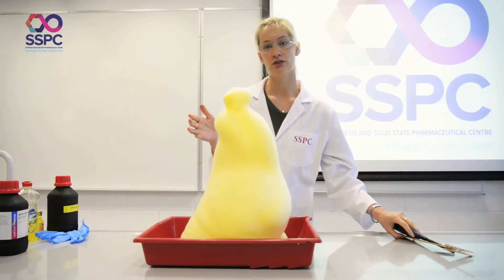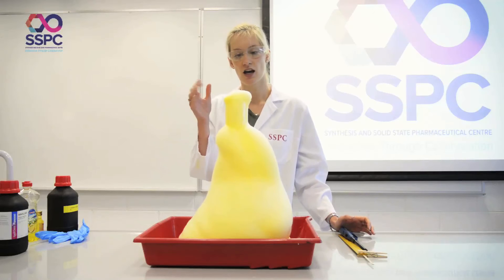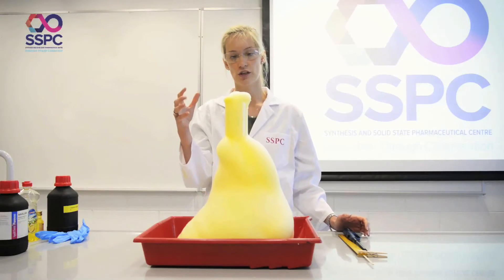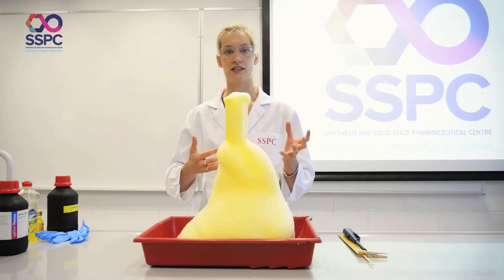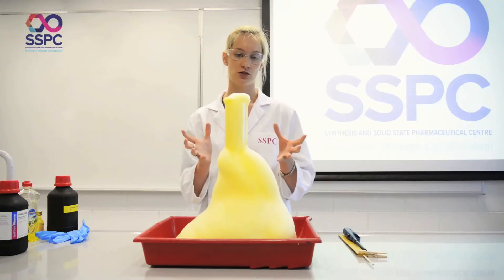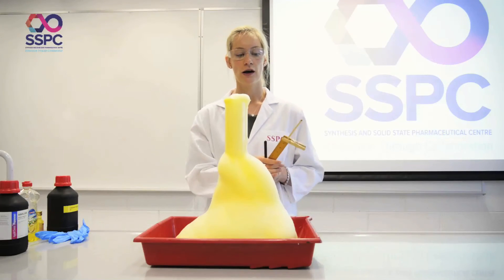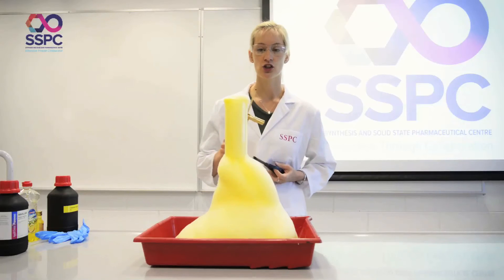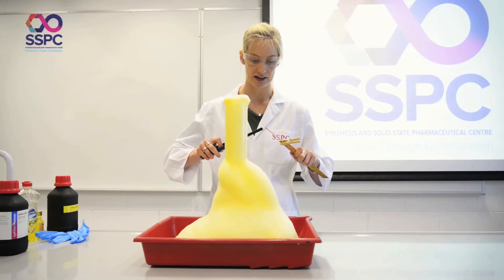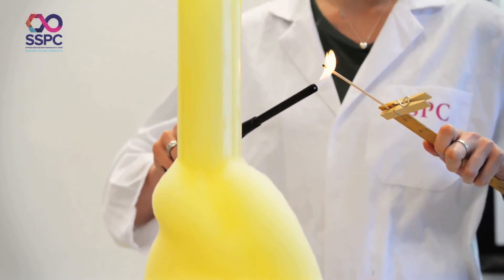Depending on what level you want to use this as a teaching tool — if you want to use it at higher level, fifth year, Leaving Certificate, or Transition Year, you might be talking about catalysis. However, if you want to do this as a dramatic demonstration for Junior Certificate science, you can show that oxygen is produced and prove that catalysis has taken place and that hydrogen peroxide has decomposed to oxygen and water.